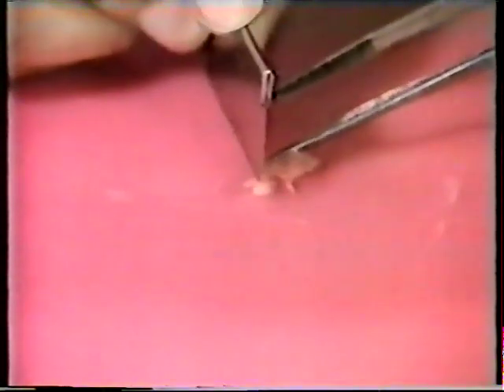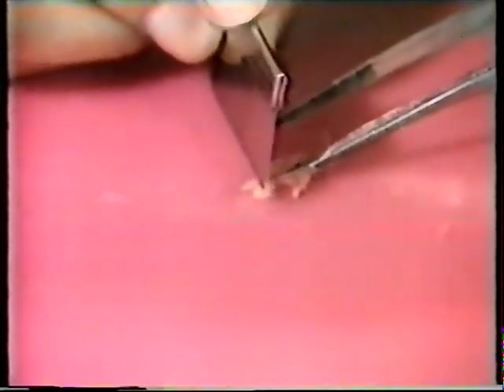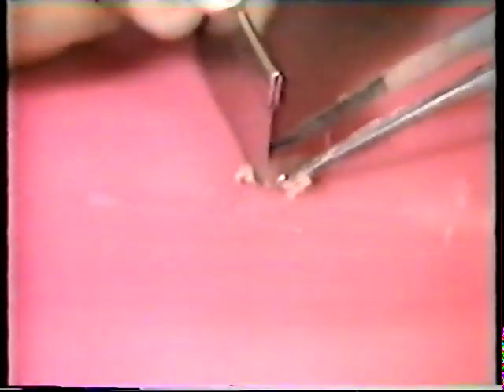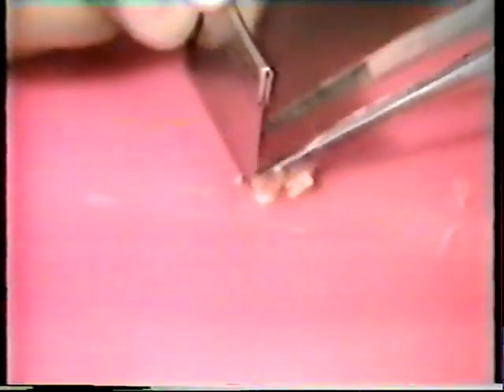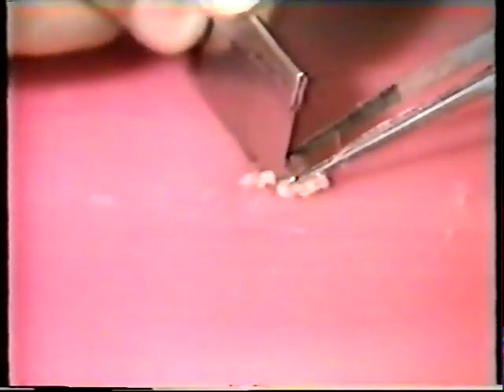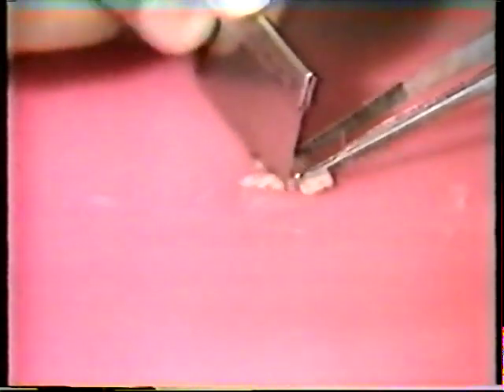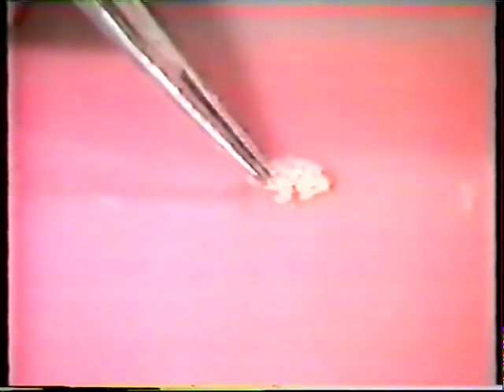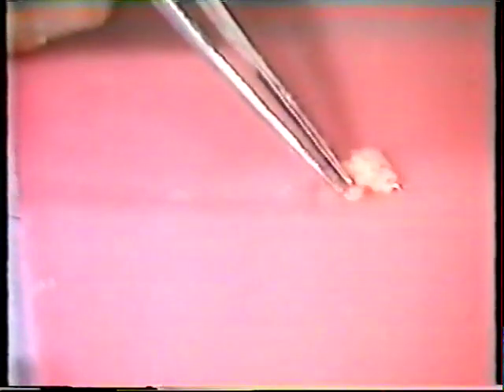This penetrates tissue very slowly, so small pieces of pancreas are cut, ideally about 1 millimetre square. This enables the fixative to penetrate all parts of the tissue.